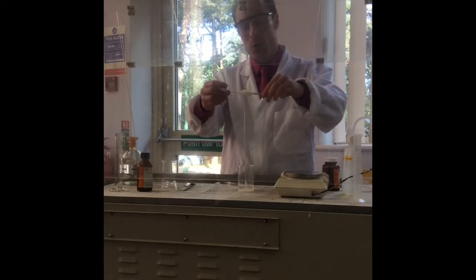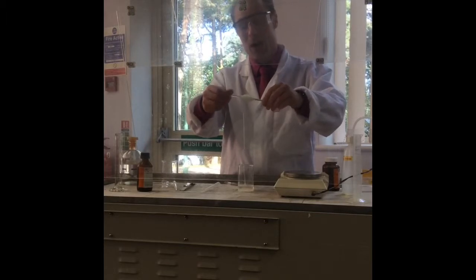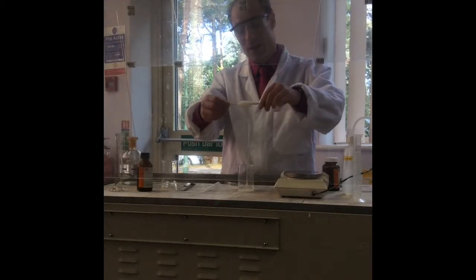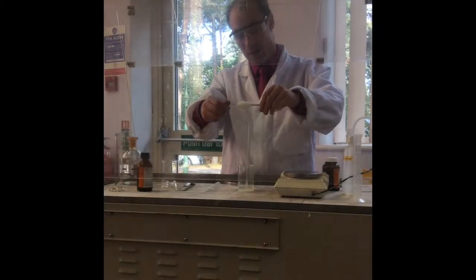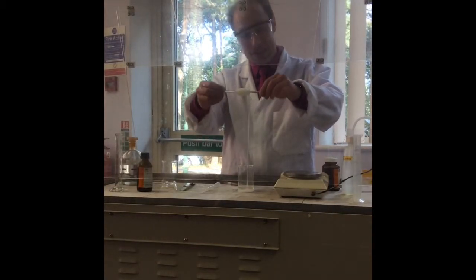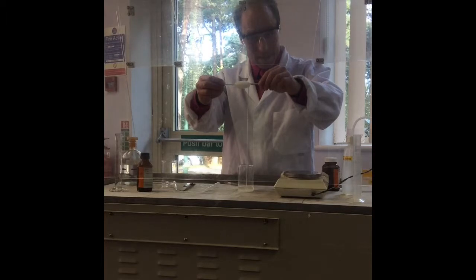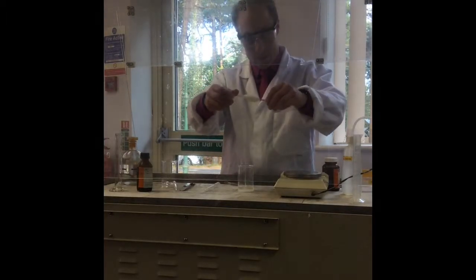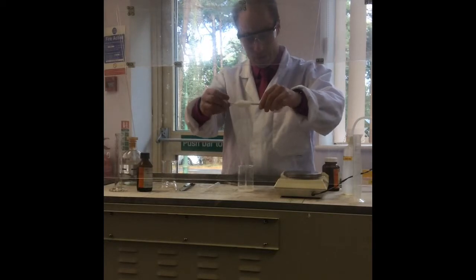Now, what you would want to do, if I allowed you to do this, and because I'm a miserable git, I'm not, is you would want to pop this, and then you squirt reactant all over your face. Start crying. So, yeah, you can't be trusted basically. But can you see how it's dripping down, where it's winding itself in on its own? That is quite a nice lump of nylon.